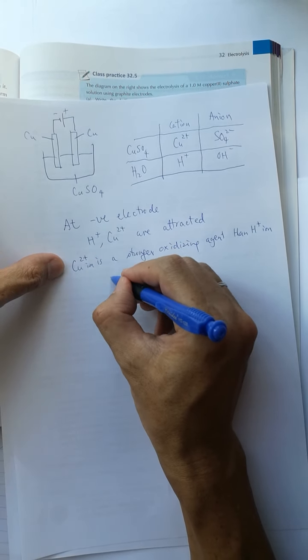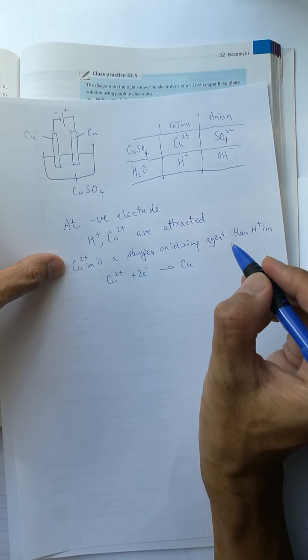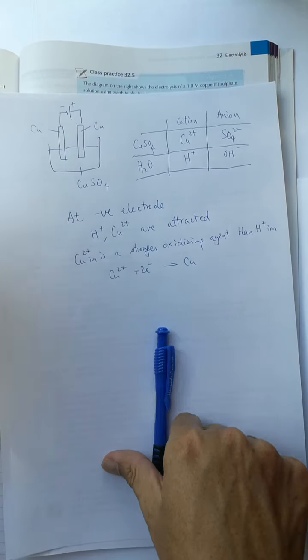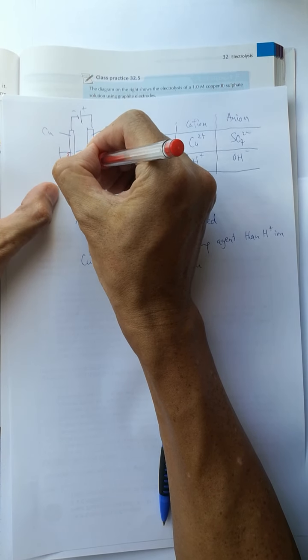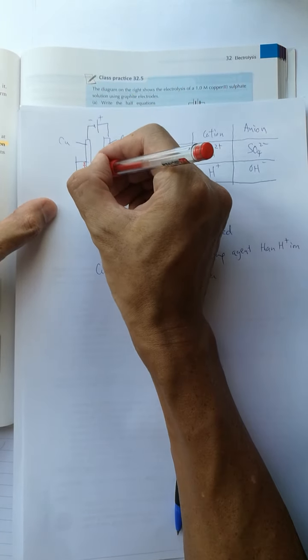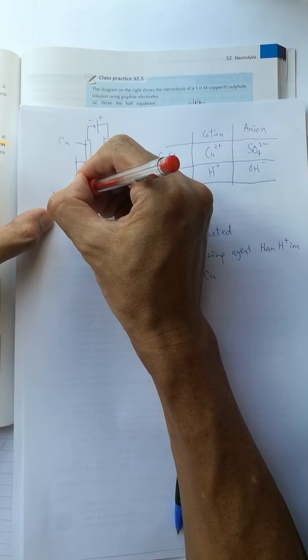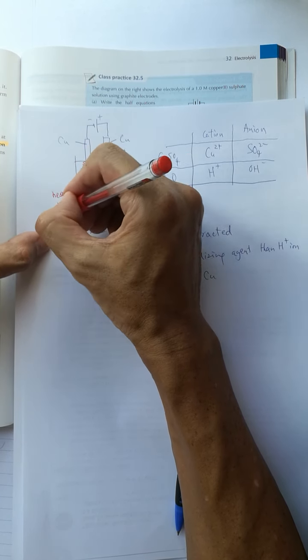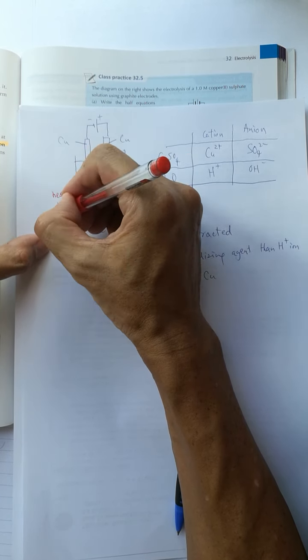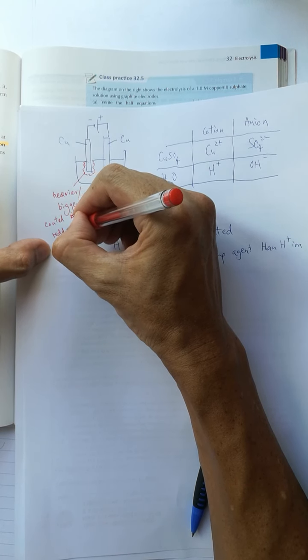So the copper-2 ions accept electrons and copper is deposited. The negative electrode becomes heavier and bigger, coated with reddish-brown metal — it is copper.